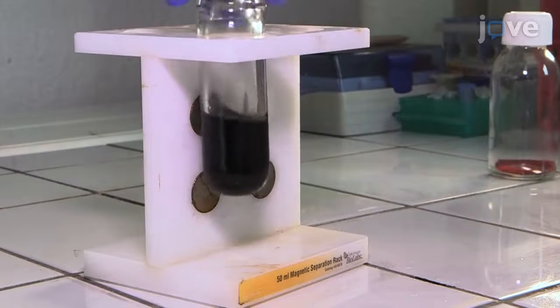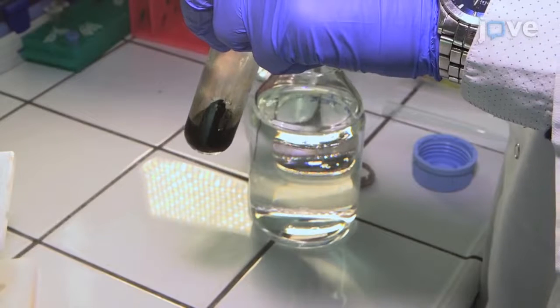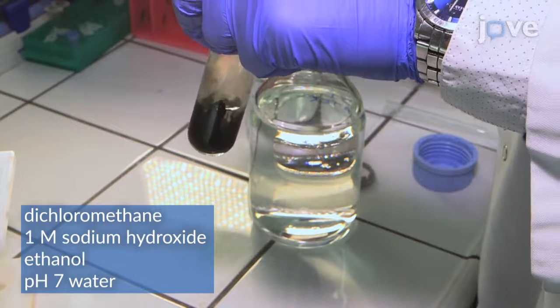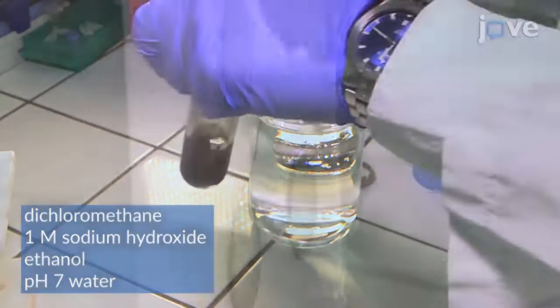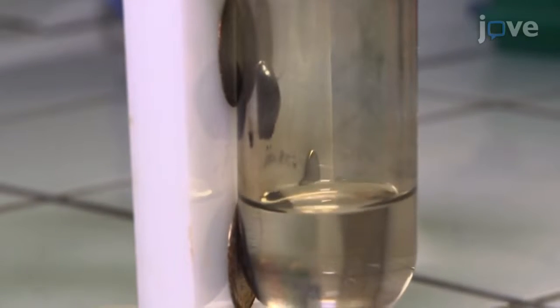To separate the nanoparticles, apply a neodymium magnet for 30 minutes. To pellet the nanoparticles, perform a series of washes using 10 milliliters of the designated wash fluid, applying a neodymium magnet for 5 minutes.